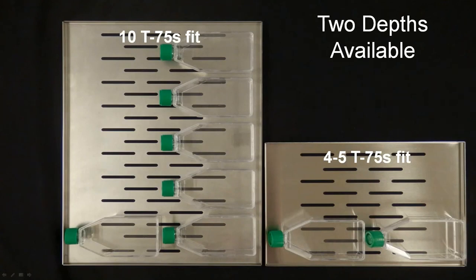You might notice that we turn these shelves so that the edges are upward. And these cell culture vessels can then be nestled down inside the shelf instead of sitting on top the way that you see in a traditional room air CO2 incubator. It's just more secure for the vessels because we do a lot of sliding the shelves in and out in order to bring those into the processing chamber area as we access things. So this is a deliberate choice.